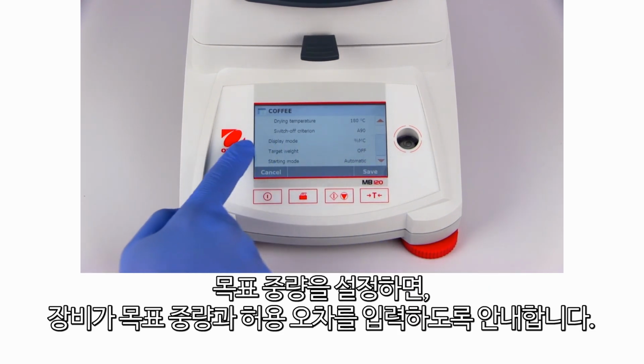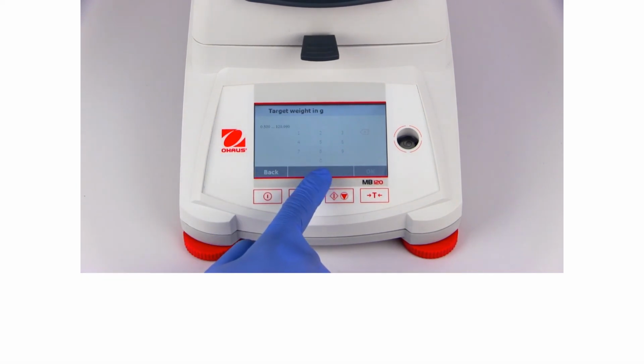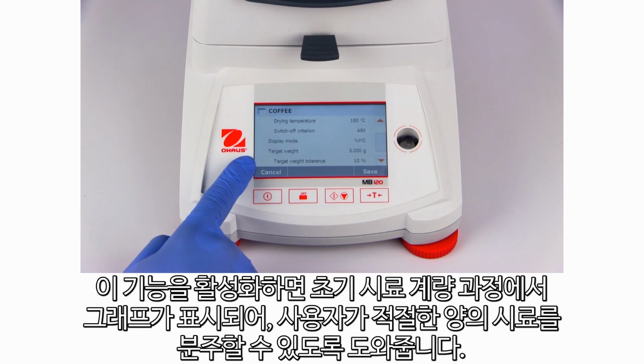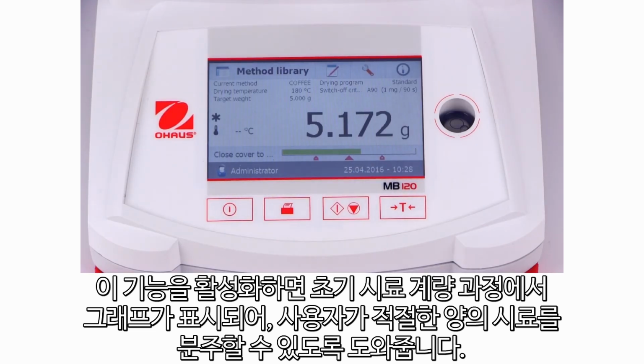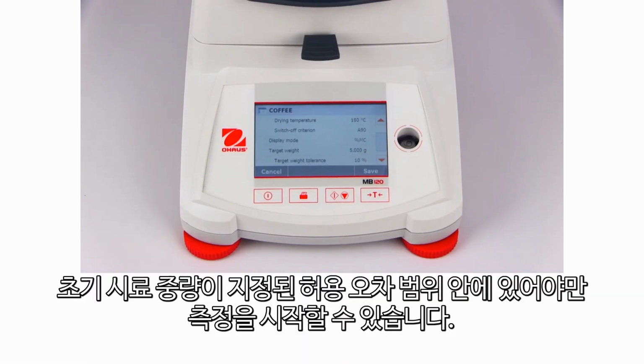If set, the device will ask the user to define a target weight and a tolerance. Once enabled, a graph will be shown during the initial sample weigh-in process, aiding the user in dispensing the correct amount of sample. The measurement cannot be started unless an initial sample weight is within the specified tolerances.